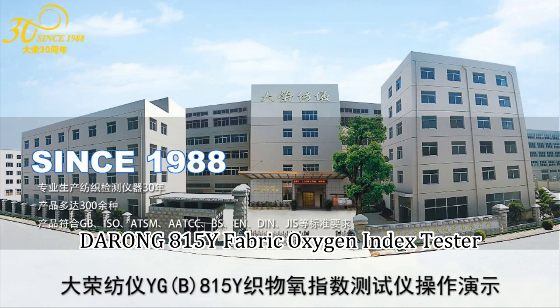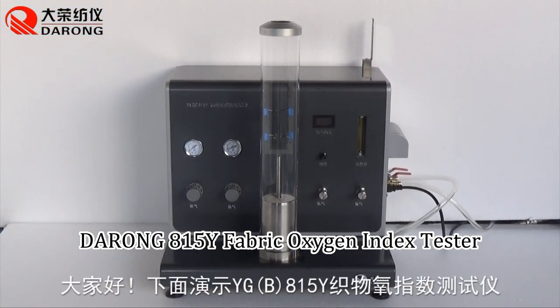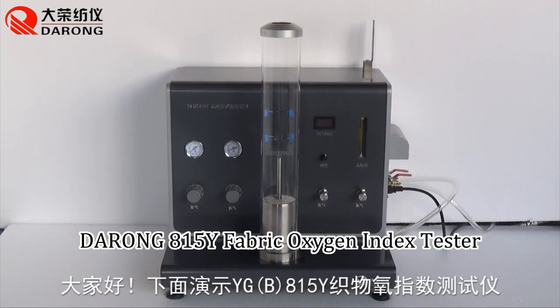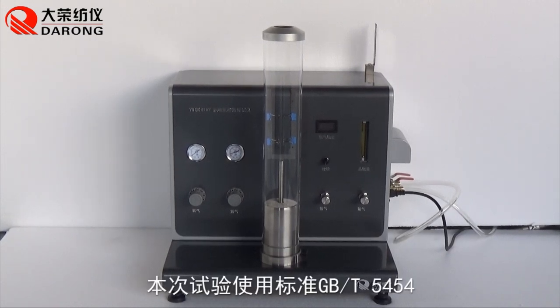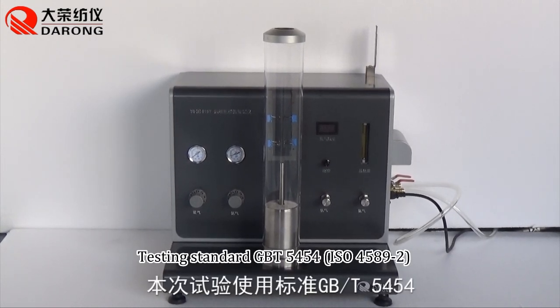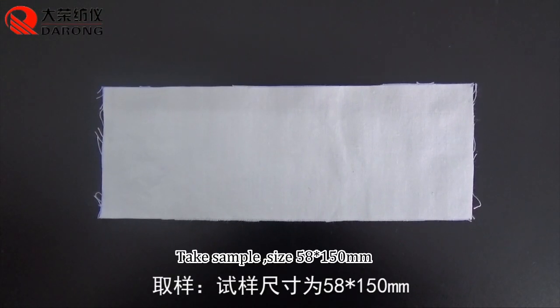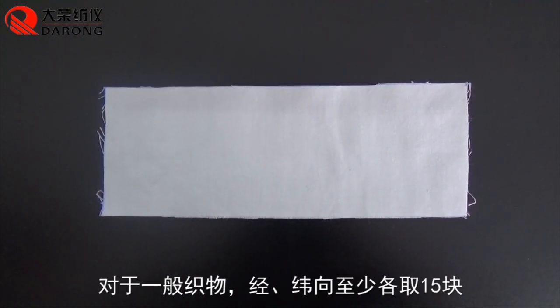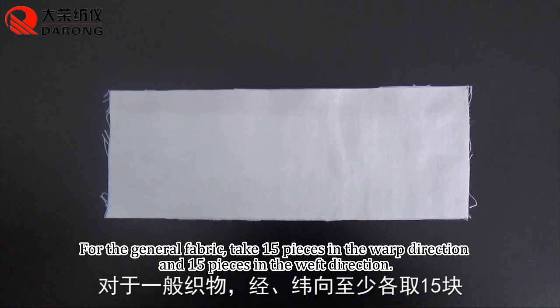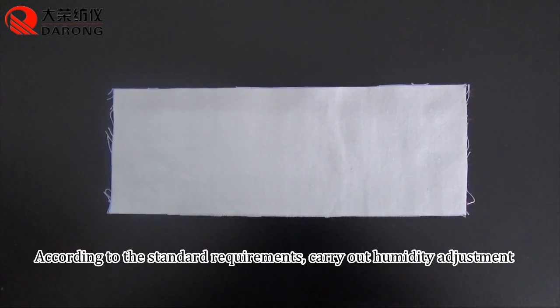To run the 815Y fabric oxygen index tester. Testing standards: GB/T 5454, ISO 4589-2. Take a sample of size 58×150 millimeters. For the general fabric, take 15 pieces in the warp direction and 15 pieces in the weft direction.